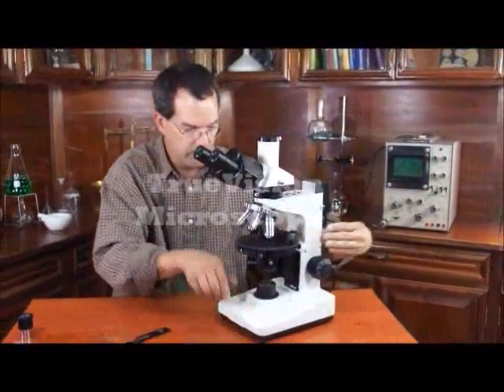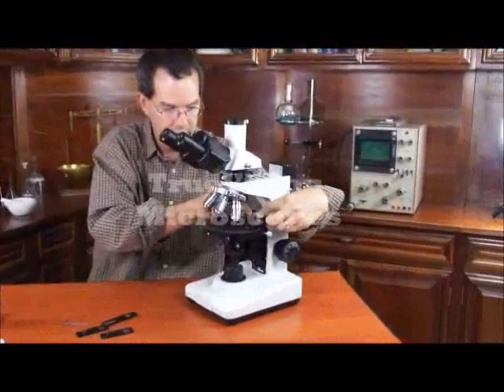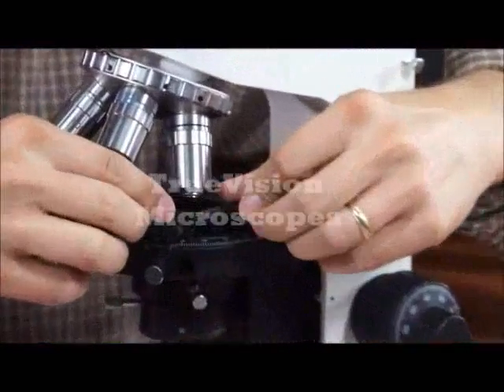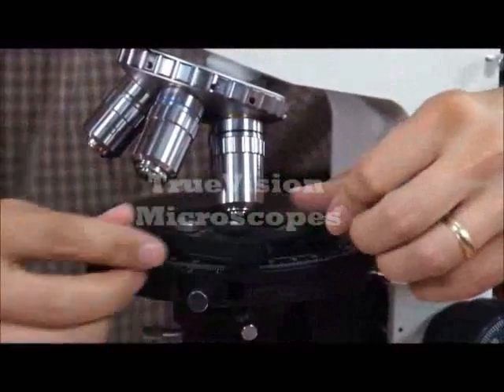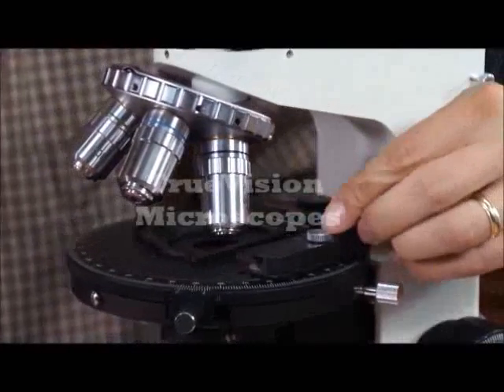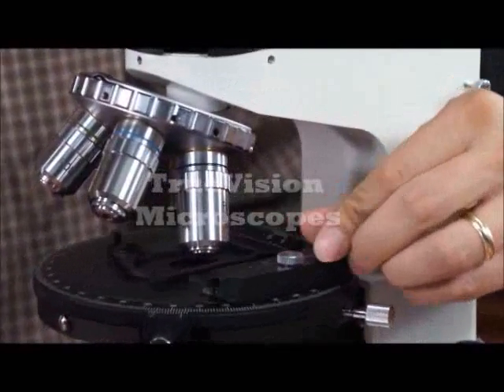The slide holder has X and Y movements — X direction and Y direction.